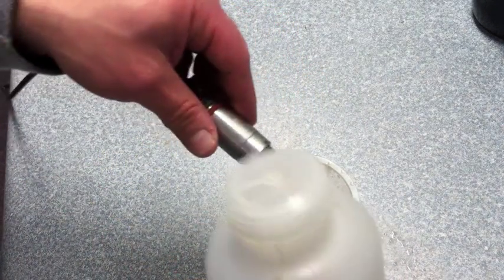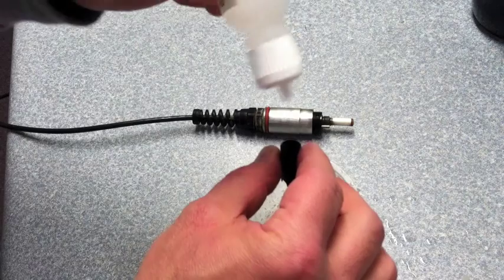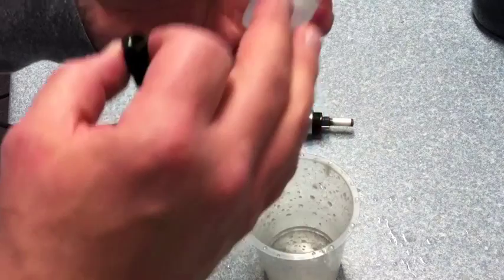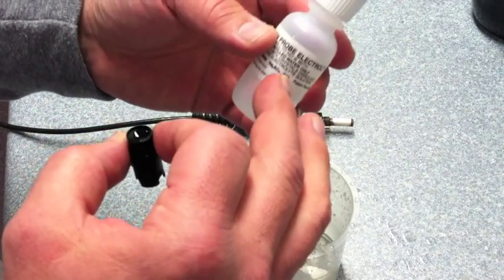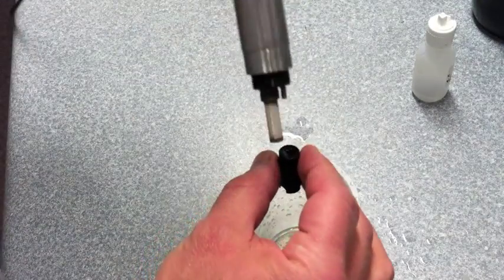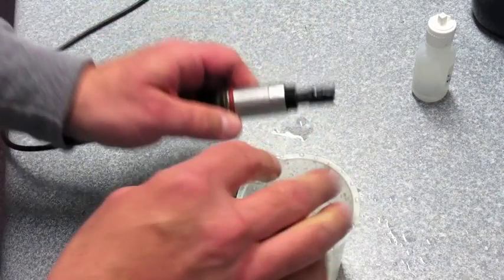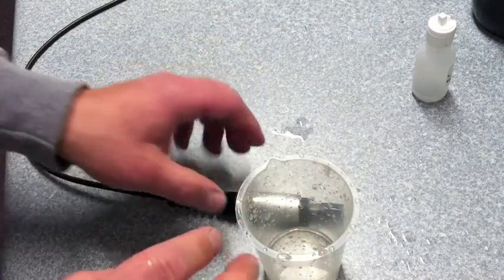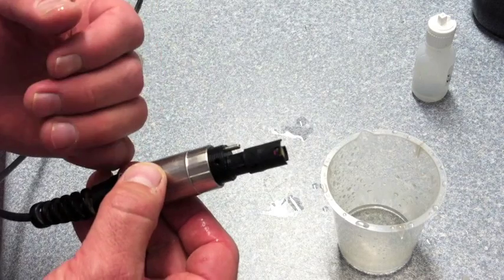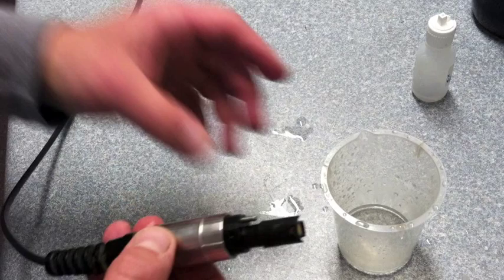As far as your cap installation, make sure you take a new cap and fill it with fresh probe solution electrolyte. Make sure that your solution, once initialized with distilled water, is not over a year old. Then you can fill it up to the bottom of the cap, and screw it back on. If you have a benchtop meter, it's always good to keep it on overnight with your new cap and electrolyte solution. Obviously, if you have a handheld, you're not going to be able to do that.